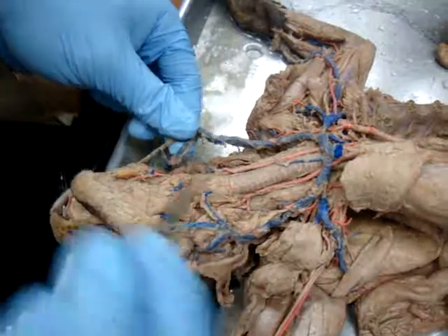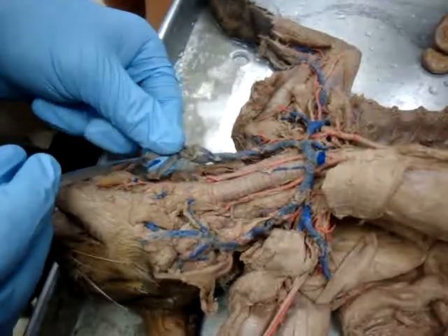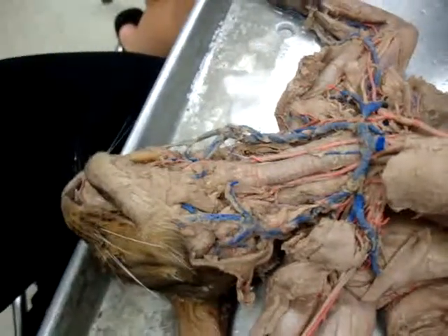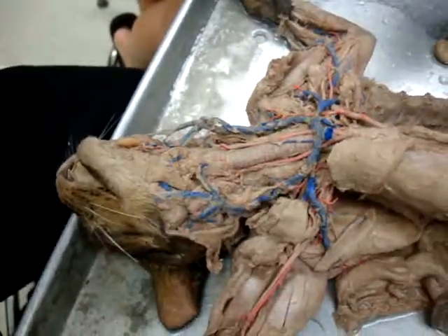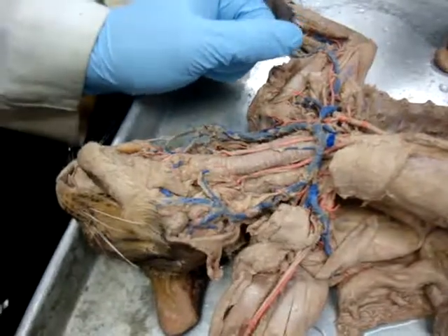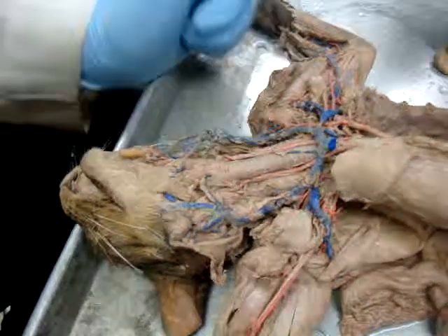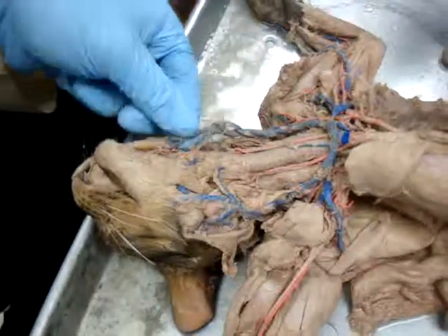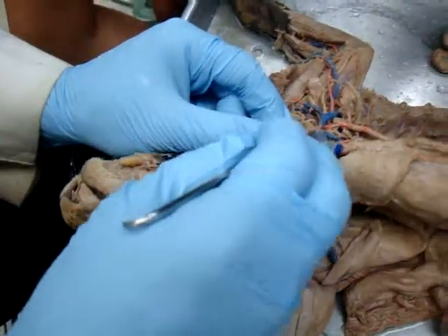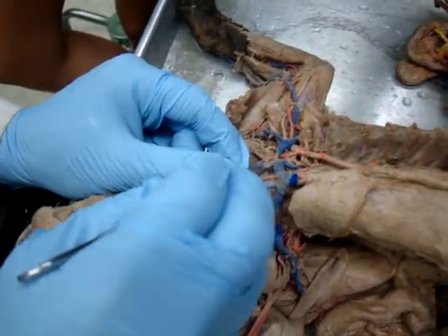Actually, the reason is probably because this is it right here. This is a normal variation. Some people have internal jugular, external jugular, and then they come together and you get what's called a common jugular, if you will. Not all that common, but it's a normal variation. So this cat probably just has that variation right there. On other cats, you will see external jugular there, internal jugular right about here.